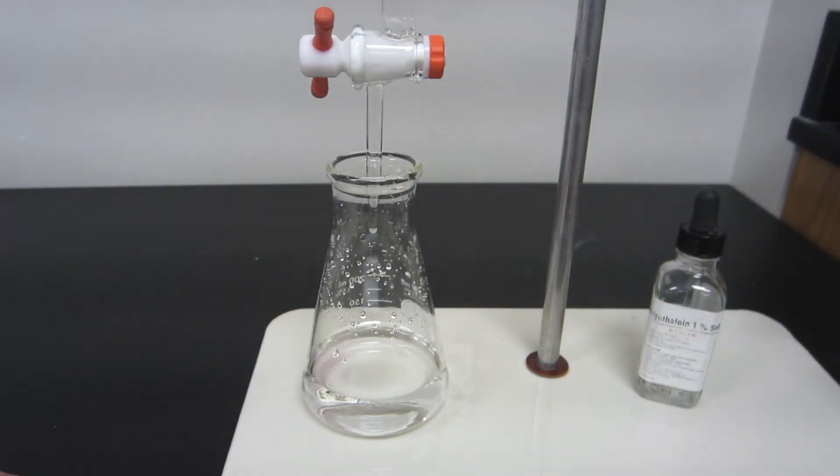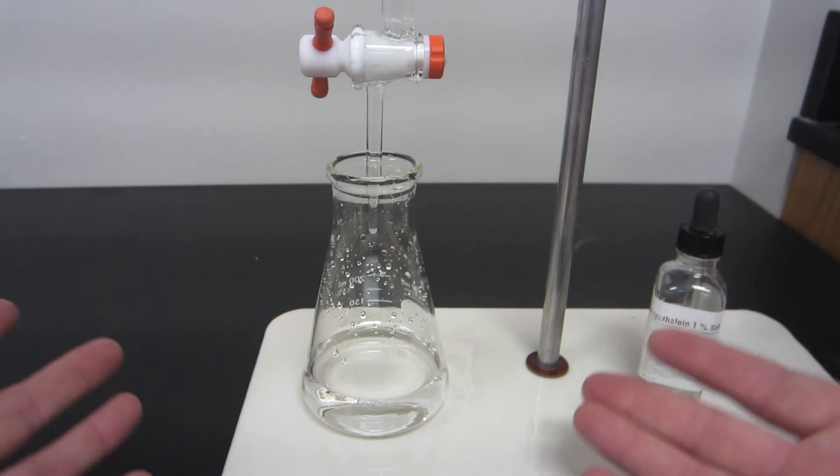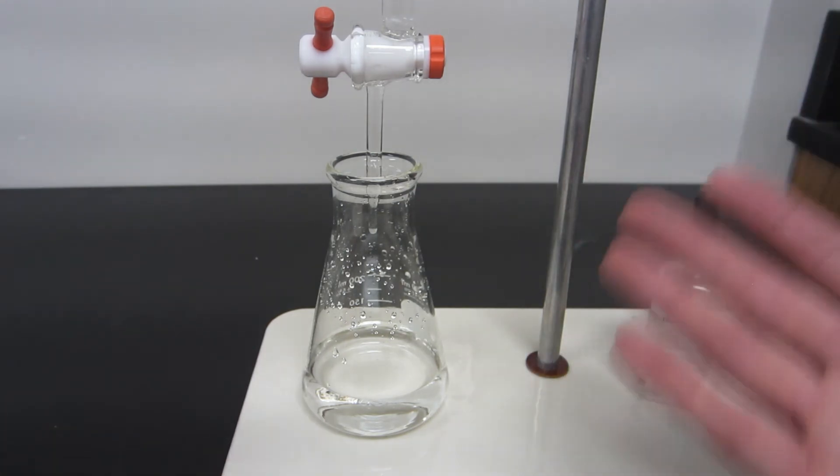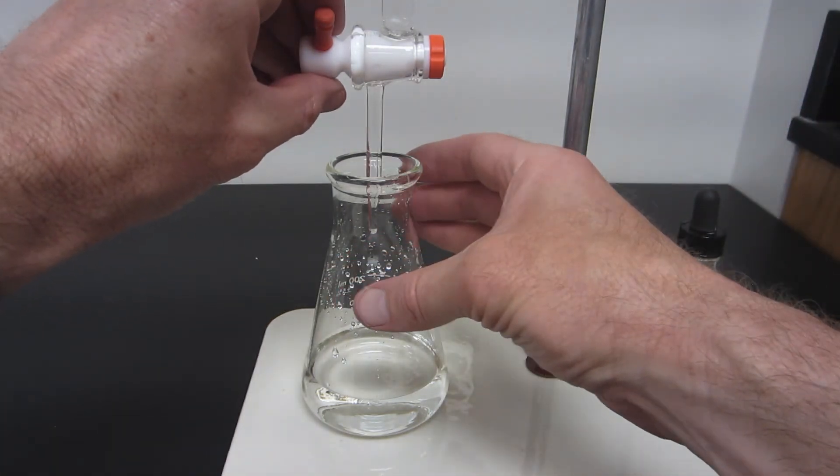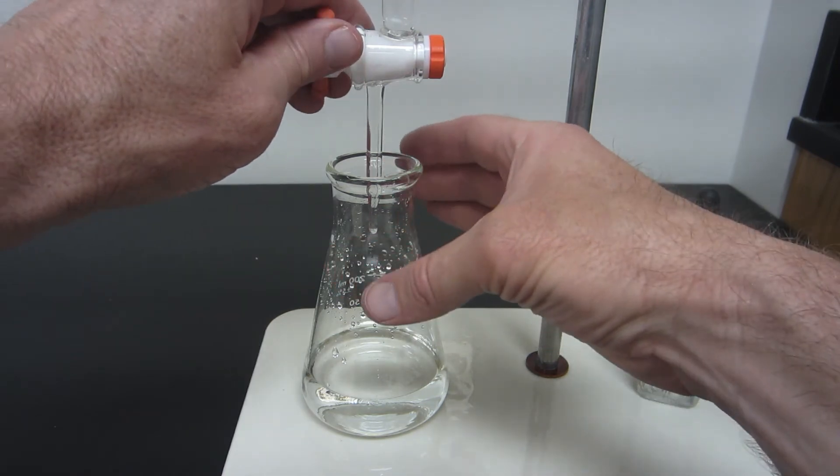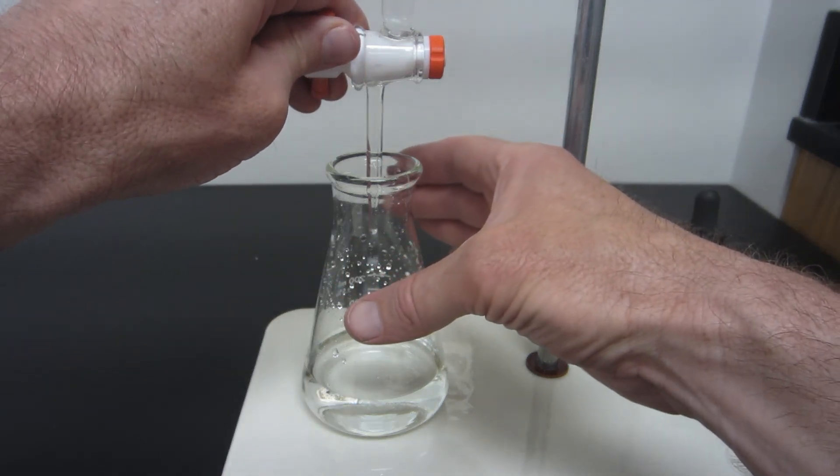That way you can add very small amounts of the volume of the sodium hydroxide very slowly. Now again, this is just a vinegar sample. This is just practice, and with this particular setup, it'll give pretty good results anyway.